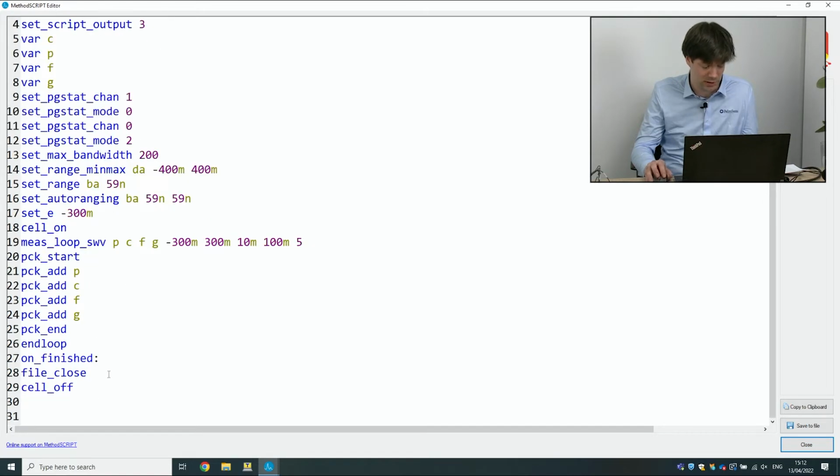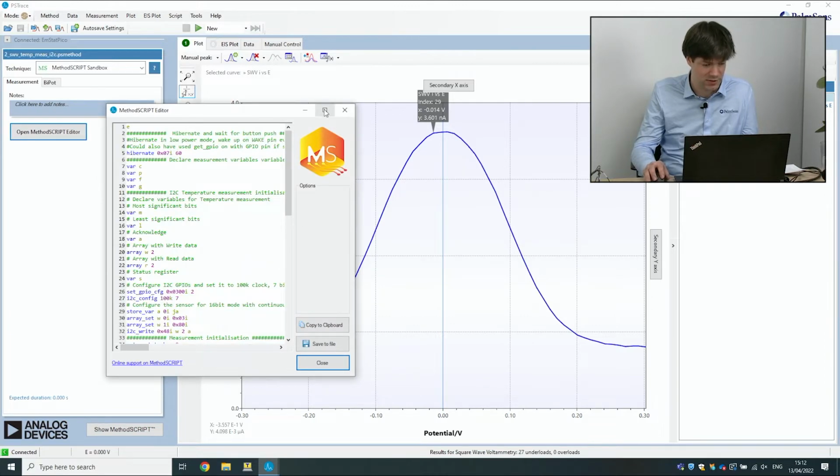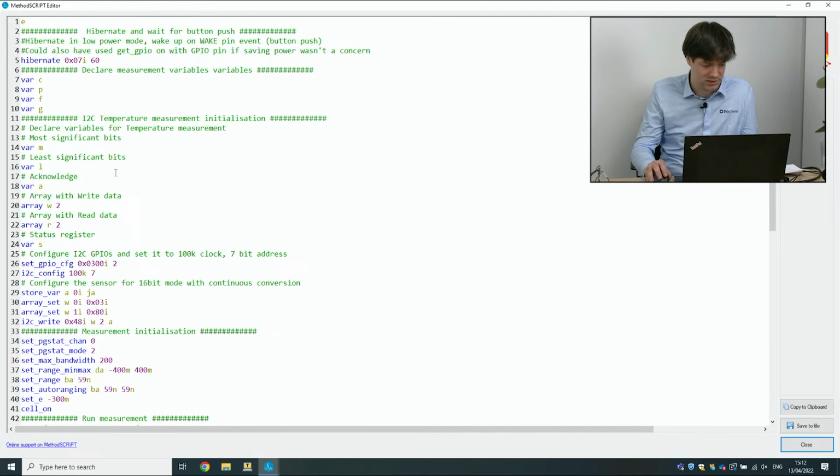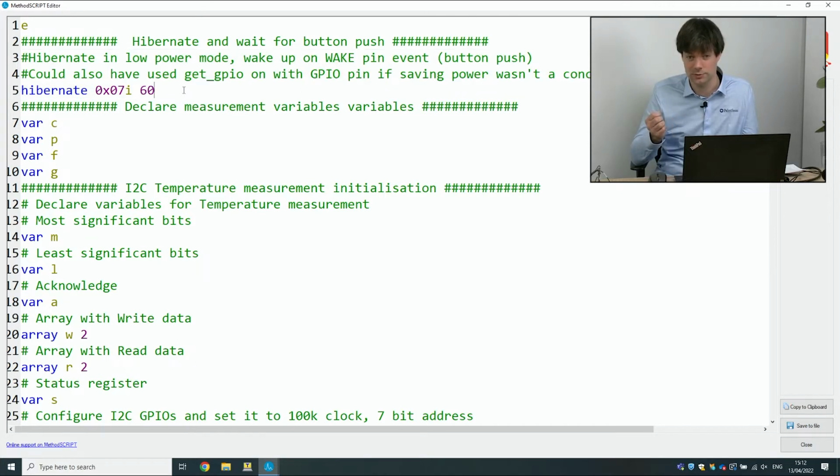So this is what the script looks like. Just for our convenience, I've made a new script already ahead of time that has some more comments and some more explanations. So I'm just going to load that. This is the same measurement, but with some extra things added. The first thing we do in the script is hibernate. This is so that if we start the measurement, it doesn't start immediately, but we can start the measurement by pushing a button on the Sensit BT later on.